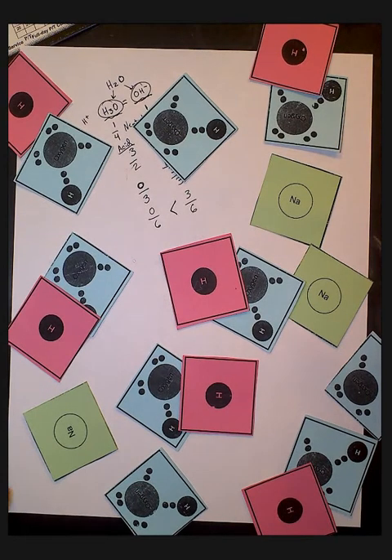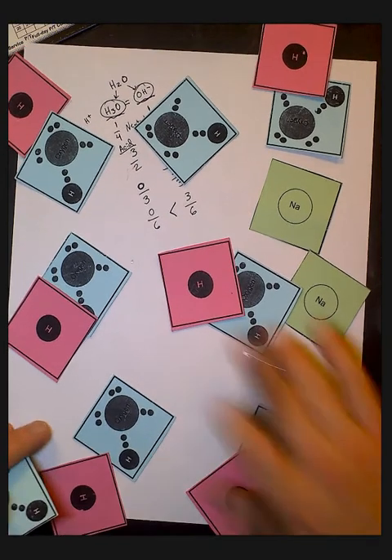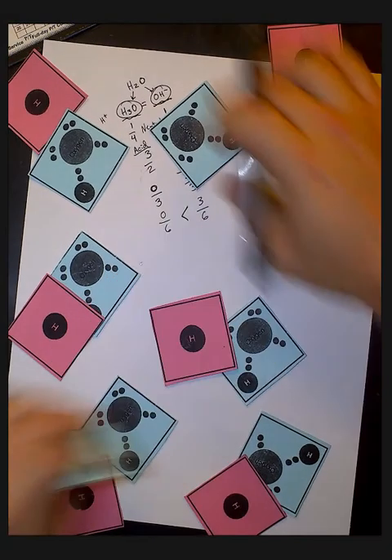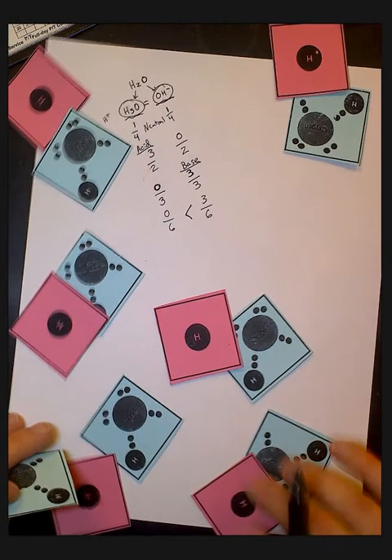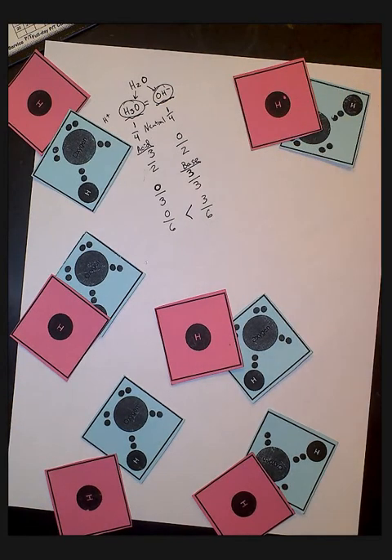Okay, let's do our last one. Group. 1, 2, 3, 4, 5, 6. All right, start off with your 10 waters. Okay, and now in this last one, we're going to add 2 things at once. We're going to add a hydrochloric acid, but we're also going to add, what else are we adding? Just make sure I'm right. Yep, we're going to add hydrochloric acid, and we're also going to add sodium hydroxide. So we're going to be adding 2 things at once.